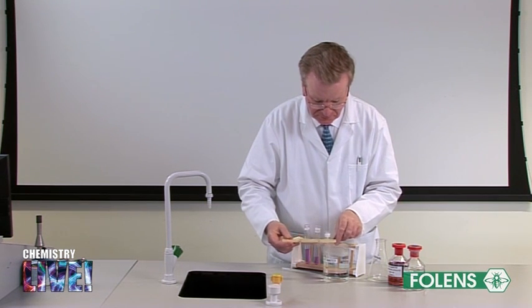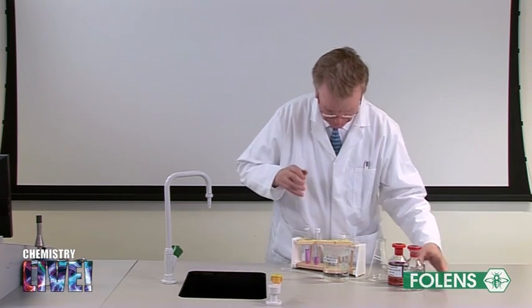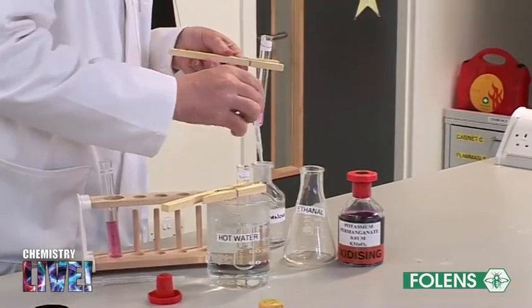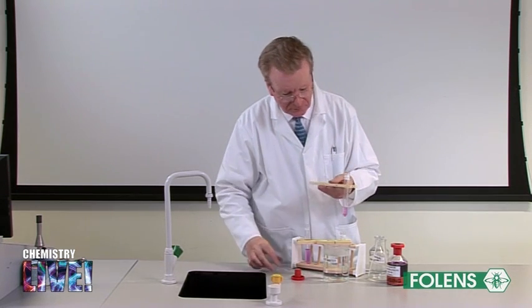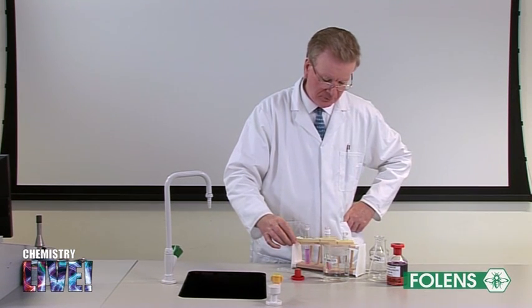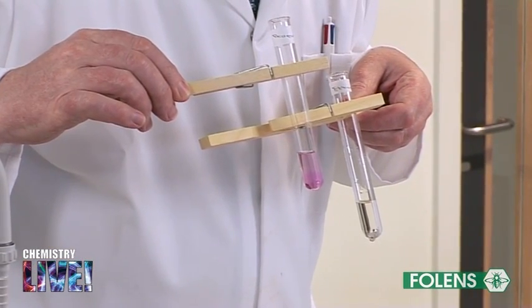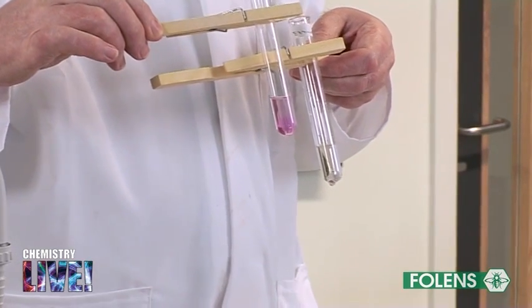Repeat the experiment with propanone. Note that there is no colour change. With the aid of your textbook, explain why there is no colour change in the case of the ketone. This concludes the first part of the experiment.